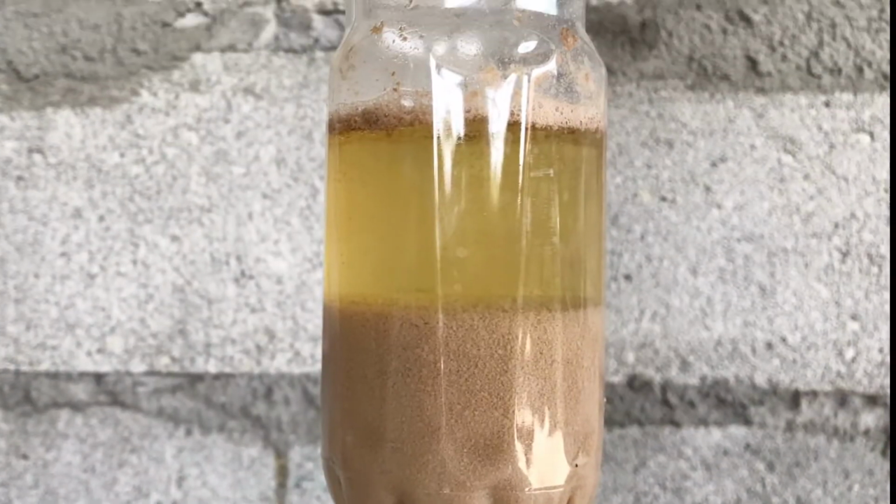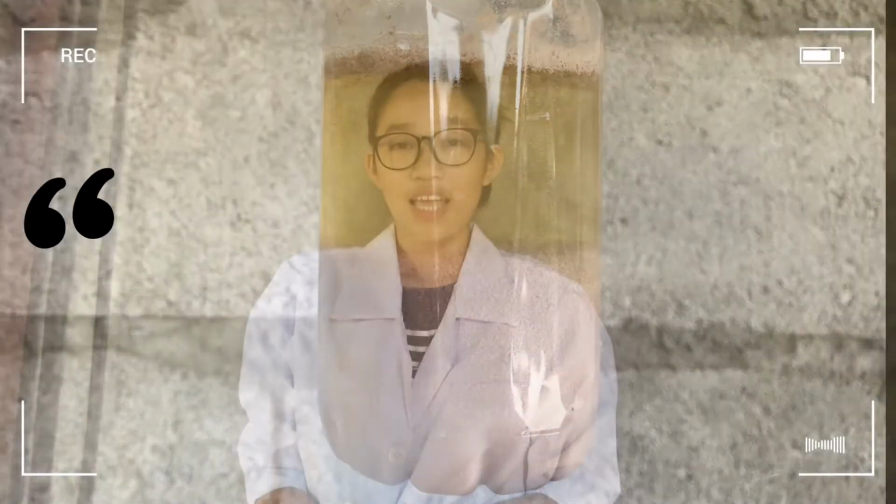This is what you get when you do the process of precipitation. Evaporation. It is used to separate homogeneous mixtures where there is one or more dissolved solids. This drives off liquid substances from the solid substances.